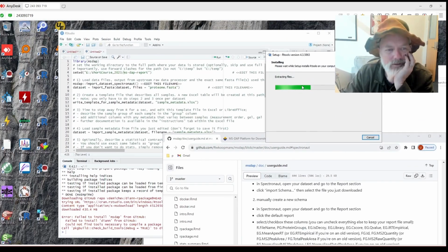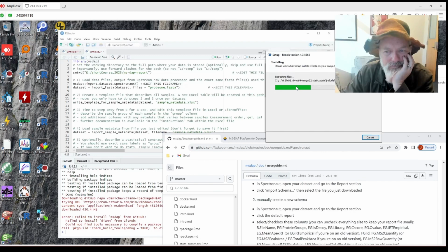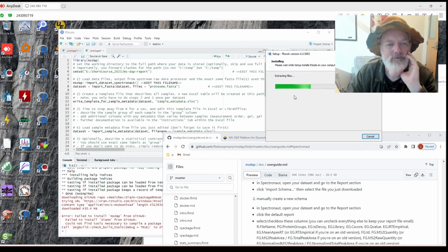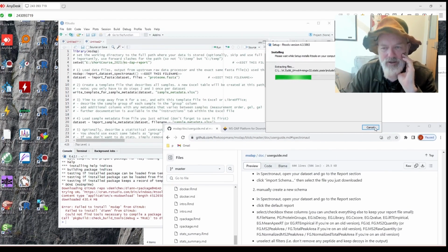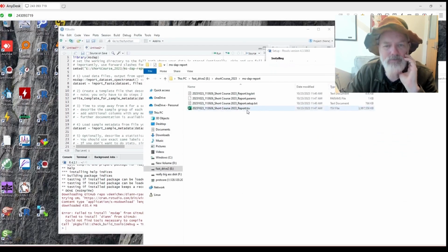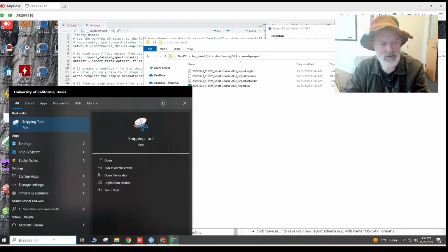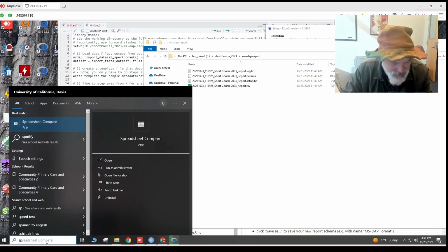All right, still installing, still installing. Okay, this can take a while. So what we're going to do is we already have our export from Spectronaut, and when I hit export report, I can show you how that works for those of you who have Spectronaut.